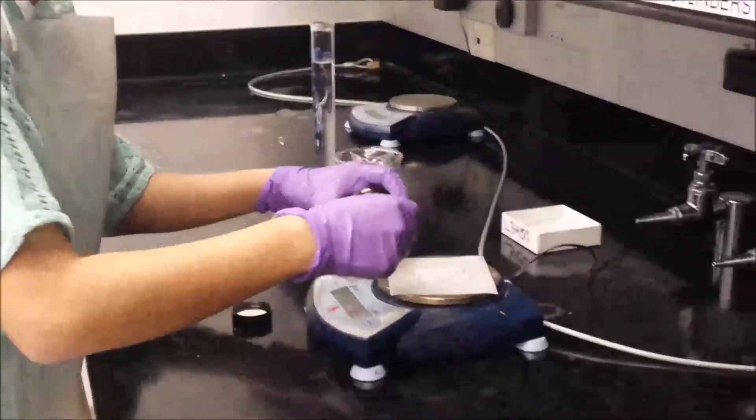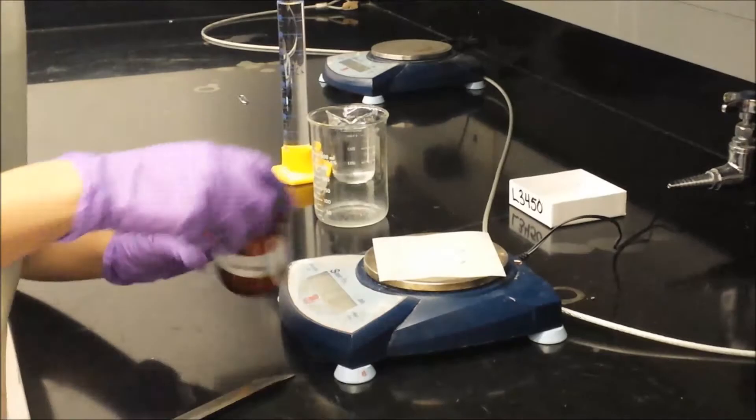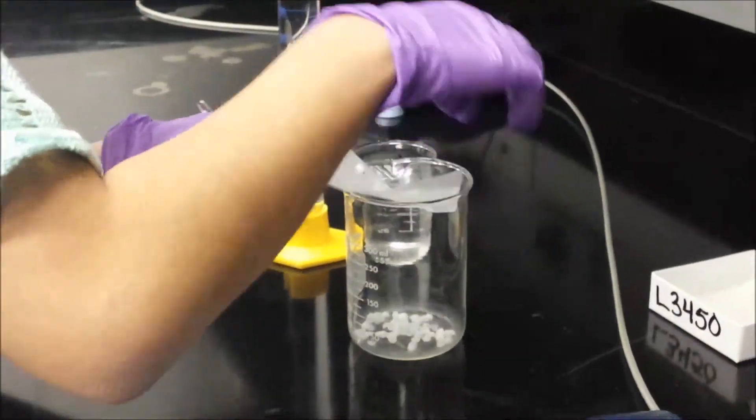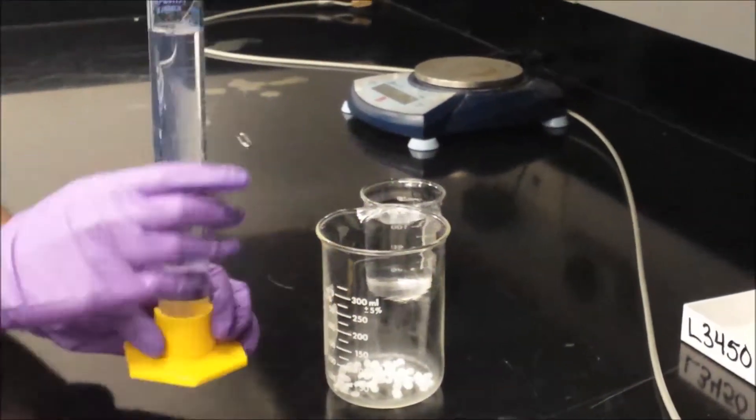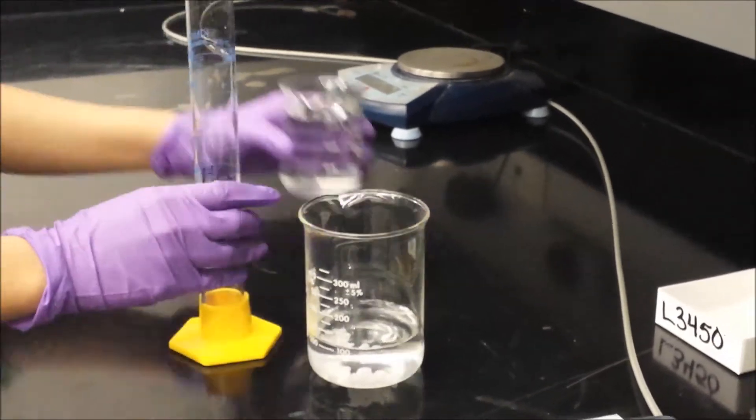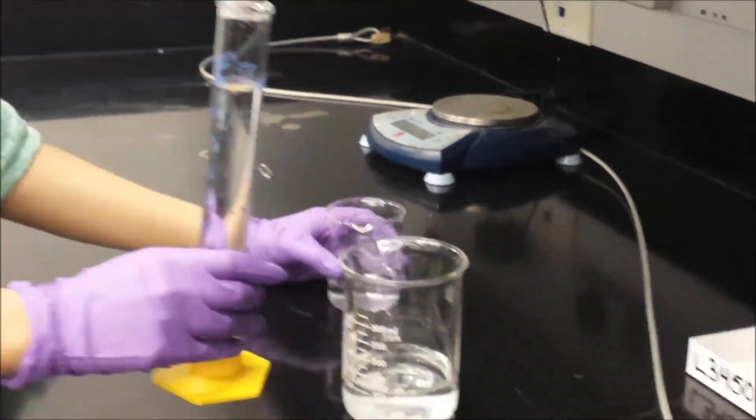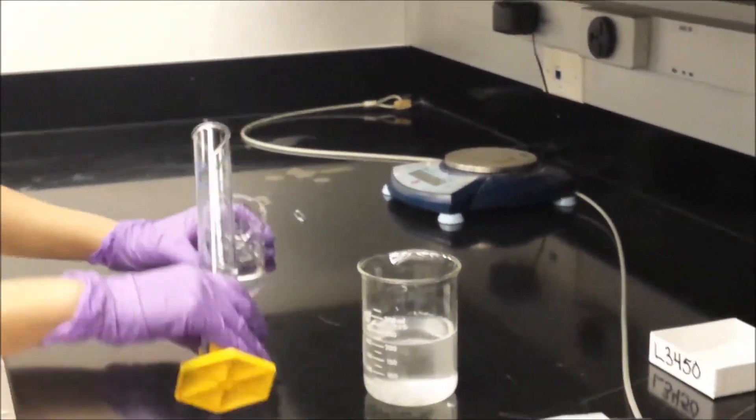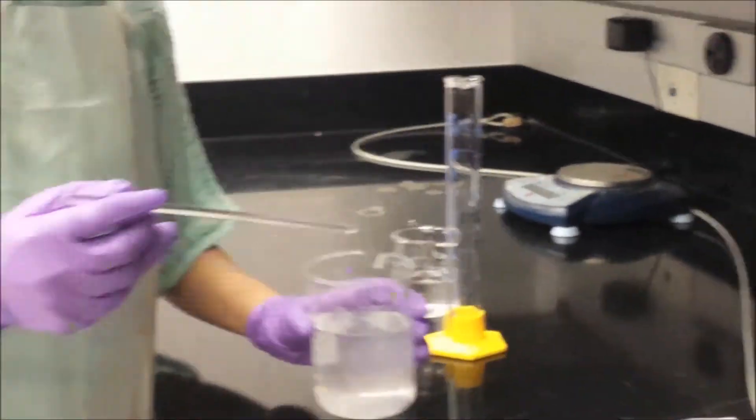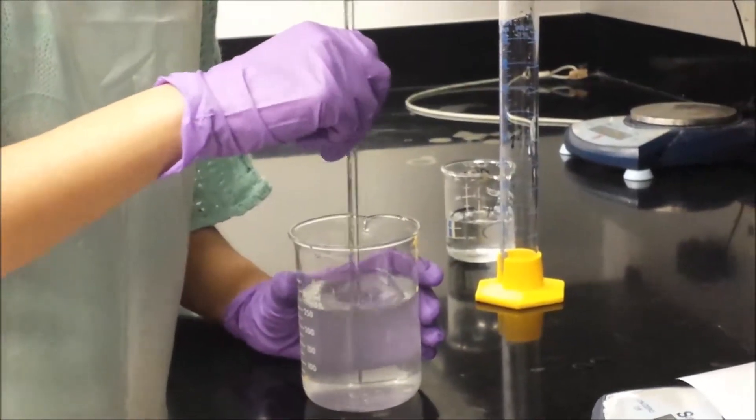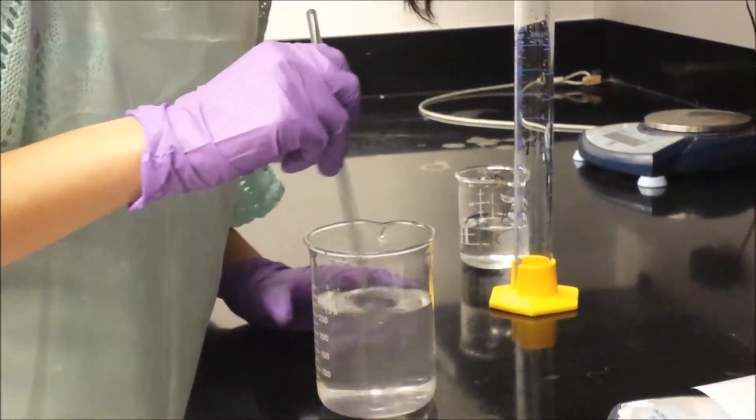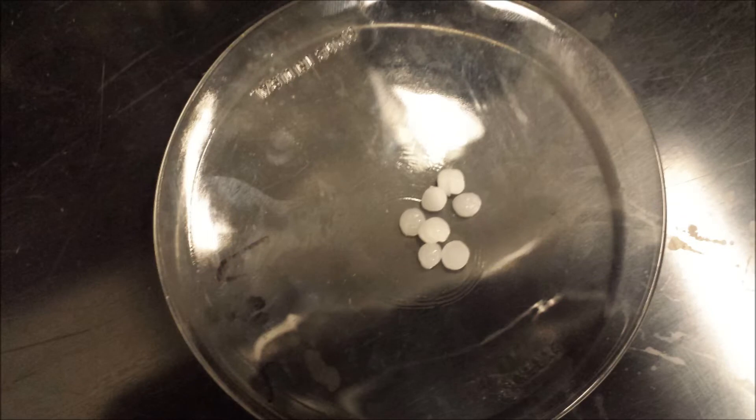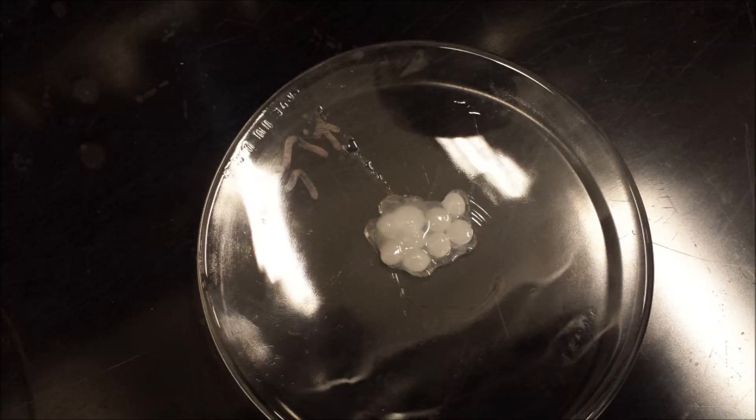Now to make the sodium hydroxide solution. After measuring about 6 grams of sodium hydroxide, start by dissolving the sodium hydroxide in deionized water to make 250ml of 0.6 molarity sodium hydroxide solution. It says to use a 250ml Erlenmeyer flask, but I would recommend a 250ml beaker in order to stir the solution with a stirring rod. Since sodium hydroxide is hygroscopic, make sure to replace the lid on the sodium hydroxide container after using it, otherwise it will liquefy.